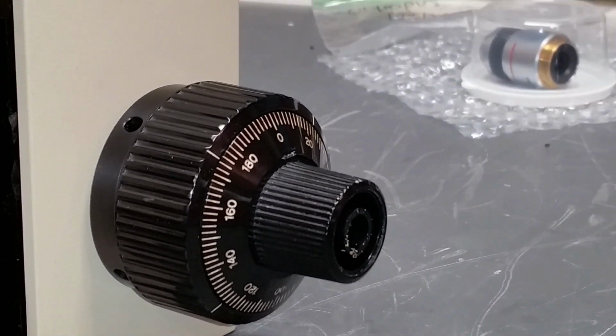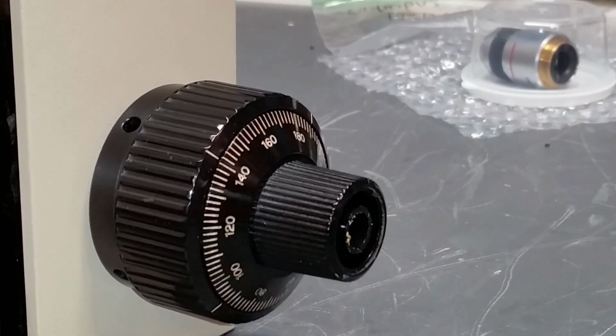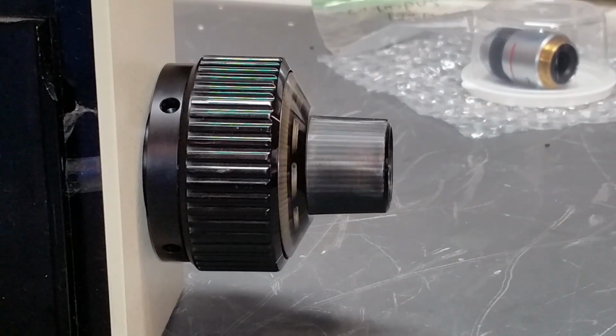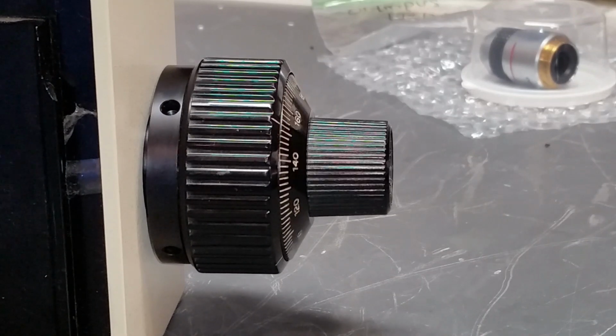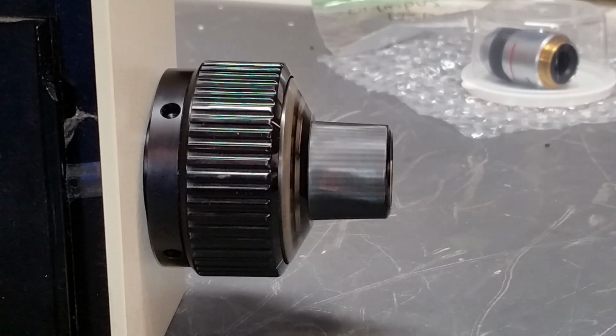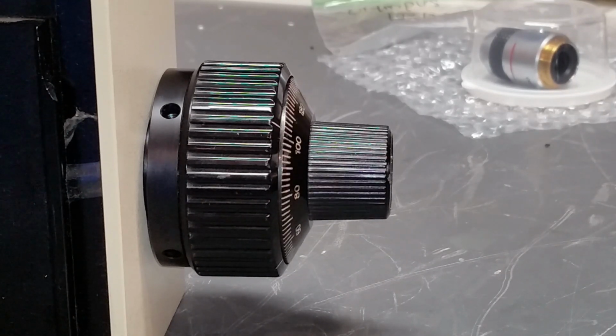if I zoom in just a little bit for you, so I rotate that on the other side. You can see it's got a little bit of a wobble to it, and the reason for that is because the fine focus shaft has been bent at some point during the life of this thing. It's taken an impact, perhaps during shipment, or who knows, but for whatever reason, that is bent.